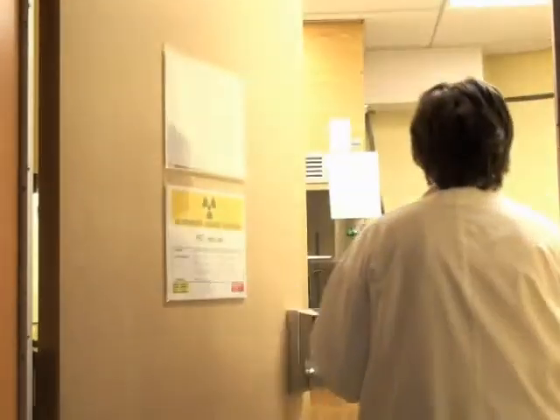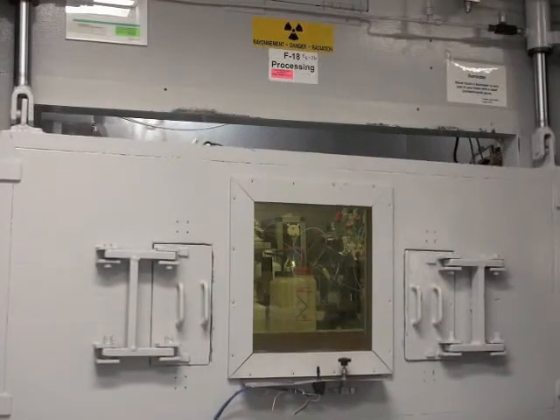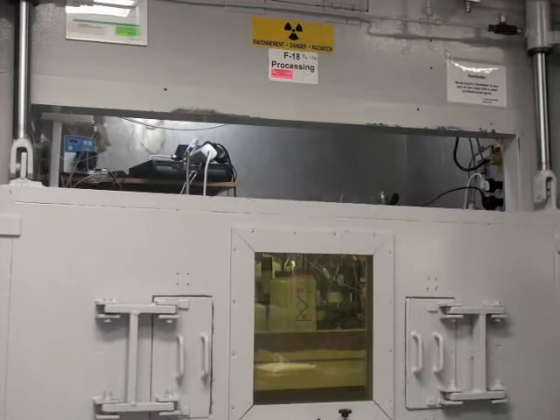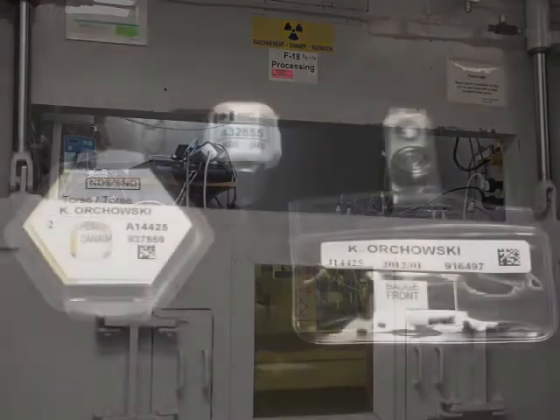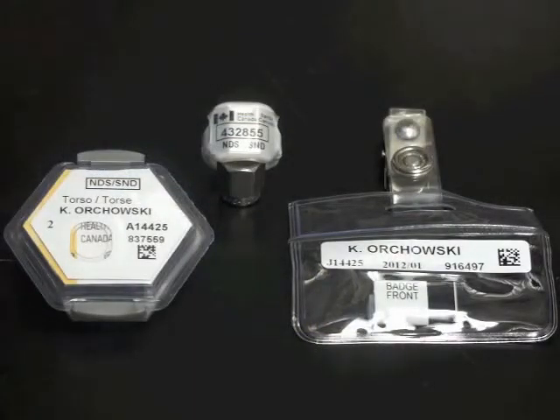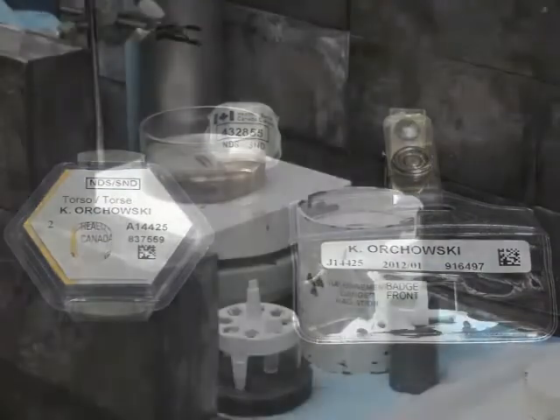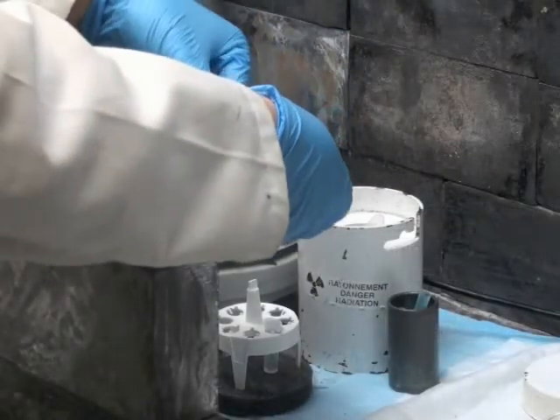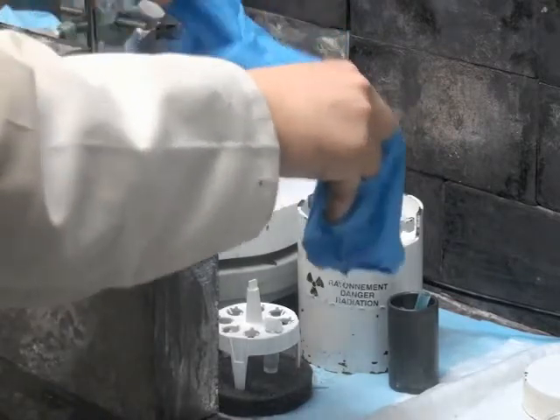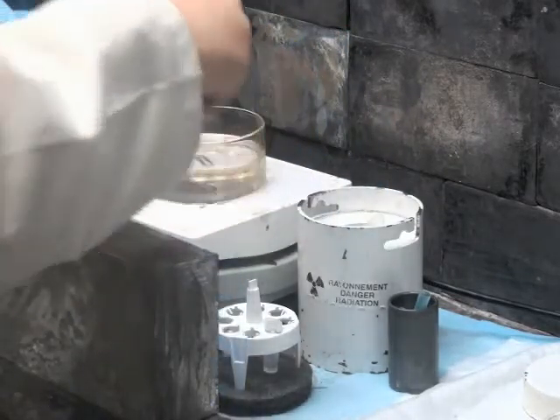One must keep in mind that fluorine-18 is a radioactive isotope. Therefore, it is necessary to carry out all procedures behind adequate shielding. Lead shielding is most appropriate for this type of radiation. Be sure to wear radiation detection badges throughout the entirety of this procedure. Additionally, immediately dispose of gloves after the synthesis, as they may be contaminated with radioactivity.